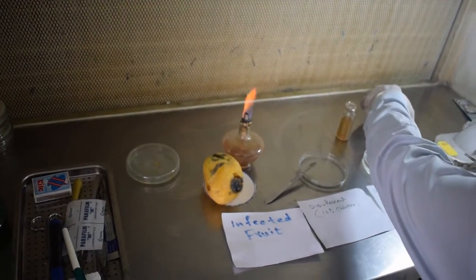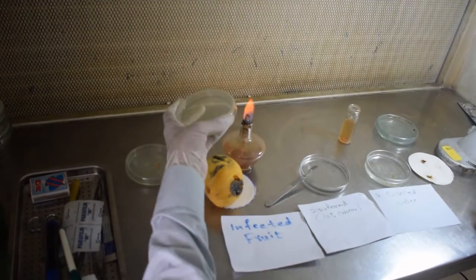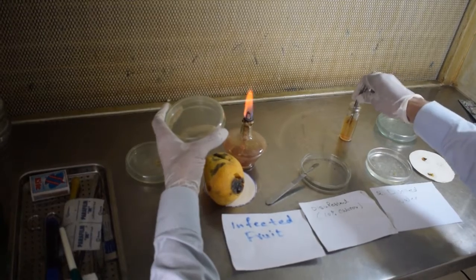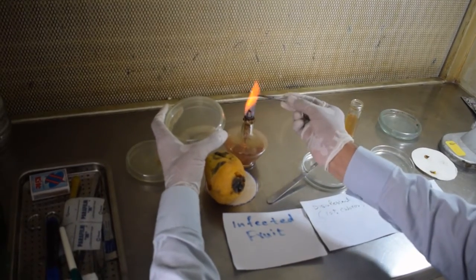Similar is the case with the second plate. This one is the petri plate. Now we should make it sterile again.